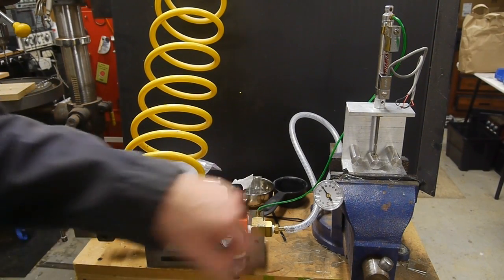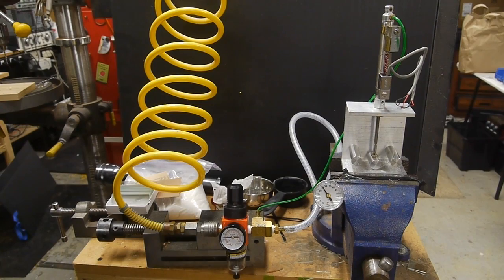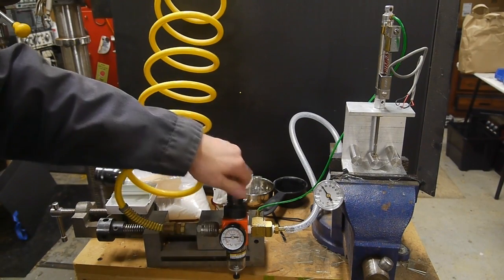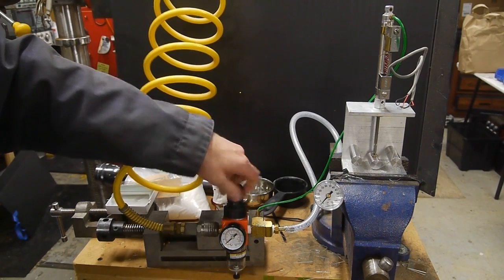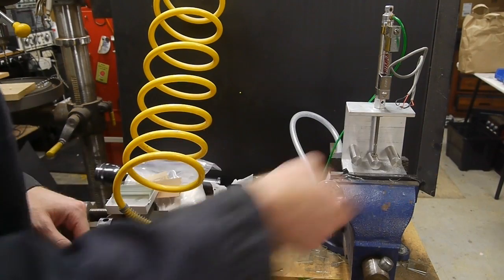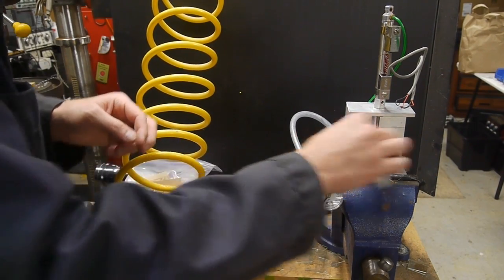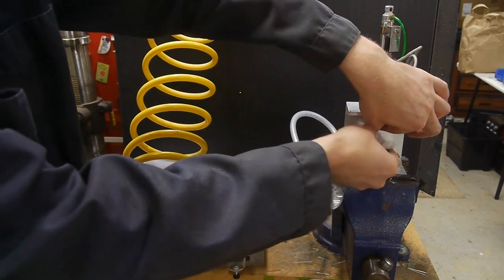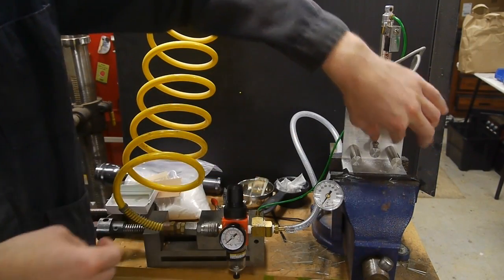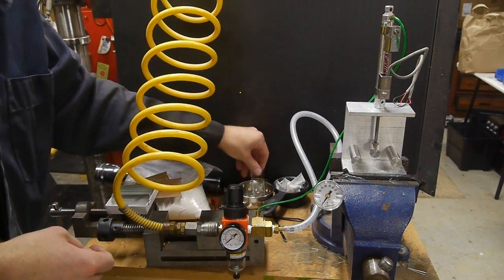Okay so that held about 24 psi before breaking so I'll unload the pressure here, clean out the glass, and I'll wipe off the surfaces there to make sure there's as little glass grit as possible.